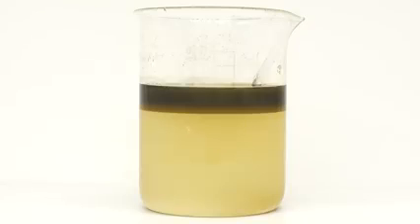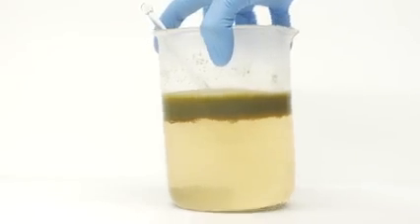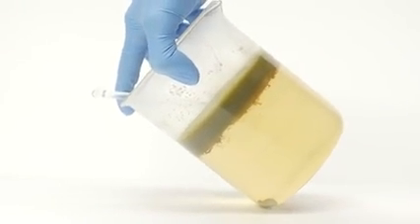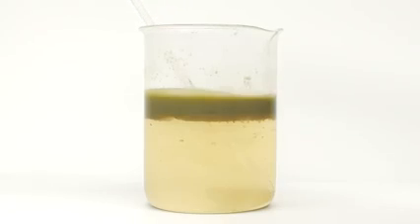Adding the hydrochloric acid caused things to heat up a little, so now it's time to wait for it to cool. When the solution is warm, most of the fatty acids are liquid, but as it cools, a lot of them will solidify. When it gets to around room temperature, the entire beaker is placed in a fridge. I left it in the fridge for a couple hours, and when I take it out, the fatty acids have completely solidified. I take out the glass rod, and then using a metal spatula, I separate the fatty acids from the beaker.